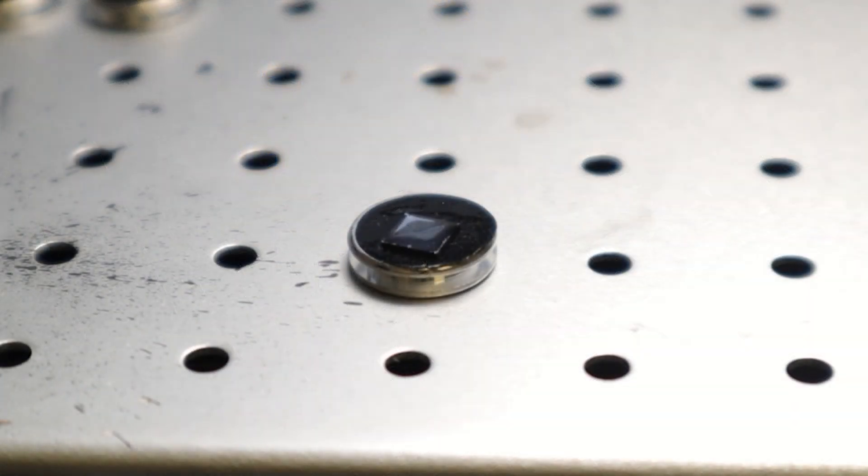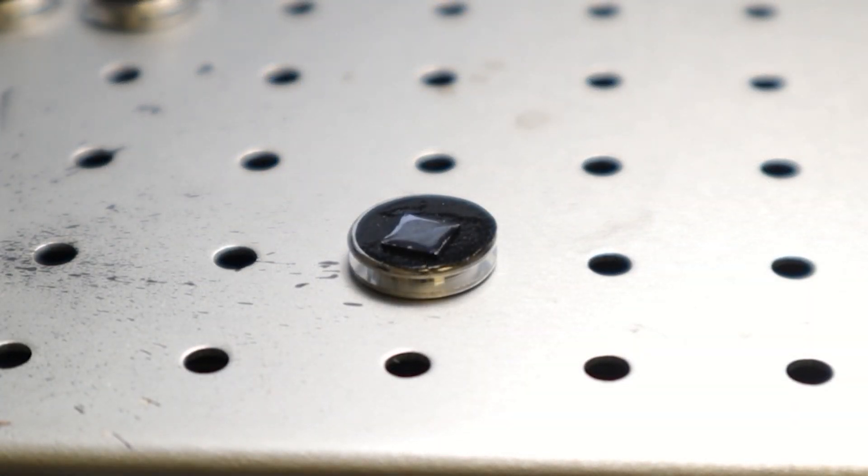We'll then allow our solution to fully evaporate before completing the final sample preparation step, which will be to blow off the sample with a canister of compressed air, just like with every other sample preparation method.